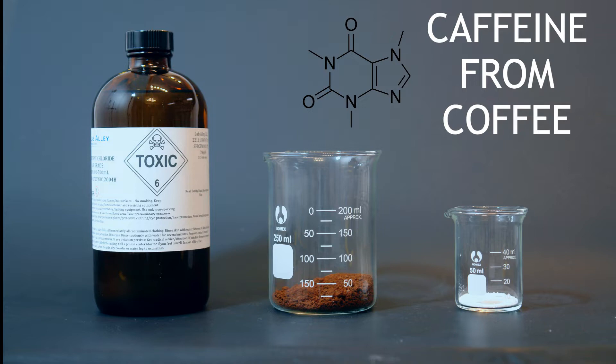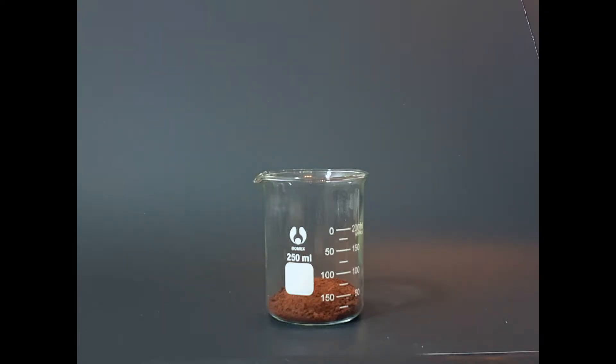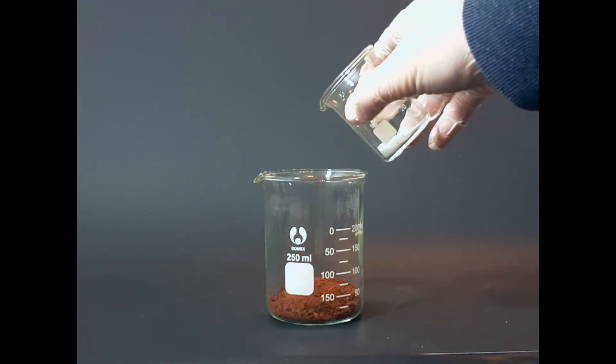Coffee is a very common substance used for a wide variety of things and is one of the most popular drinks in the world. Coffee contains a chemical known as caffeine, and that is exactly what we're going to be extracting today.